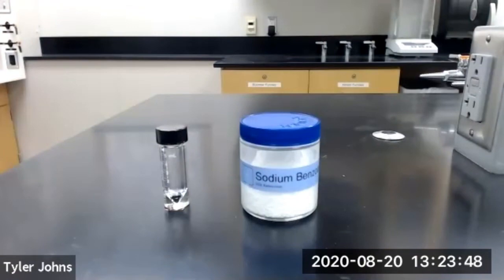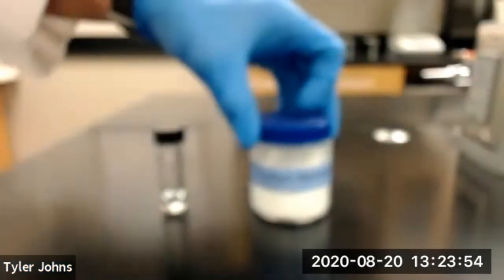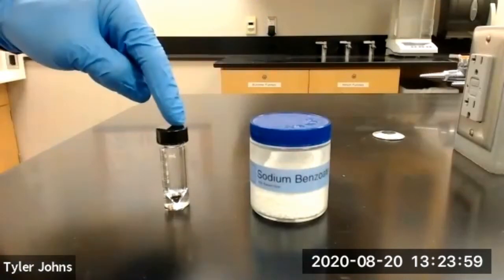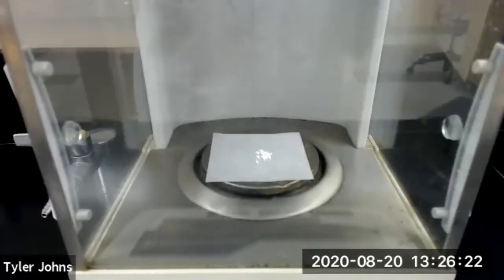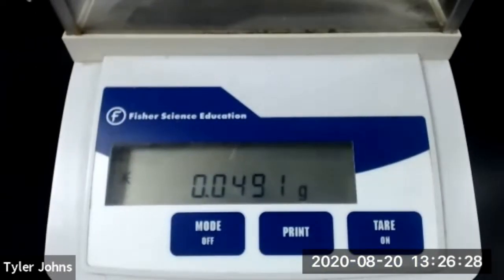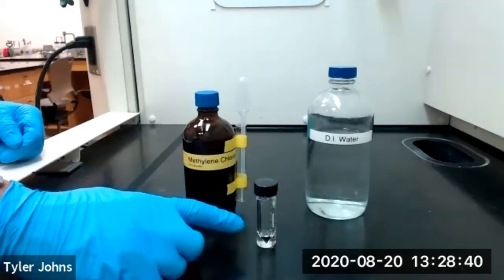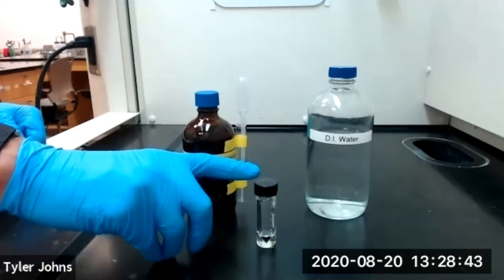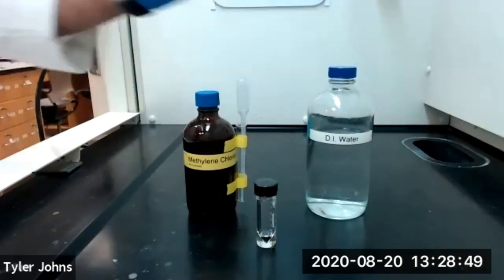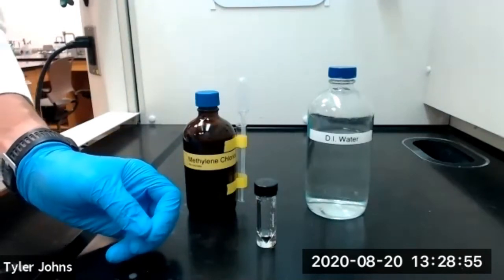We'll now repeat this procedure one last time using sodium benzoate. We first need to transfer approximately 50 milligrams of sodium benzoate to a 5 milliliter conical vial. The mass of sodium benzoate is 0.0491 grams. We'll now add 2 milliliters of methylene chloride and 2 milliliters of deionized water to our conical vial and shake to mix for about a minute until all of the sodium benzoate has dissolved.